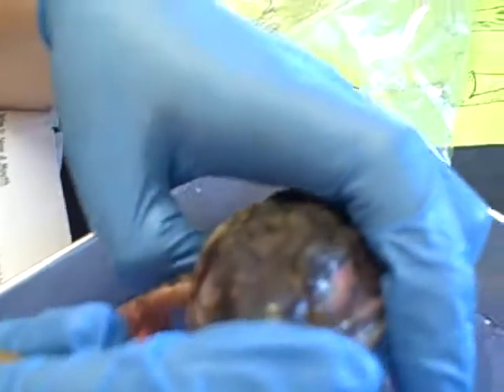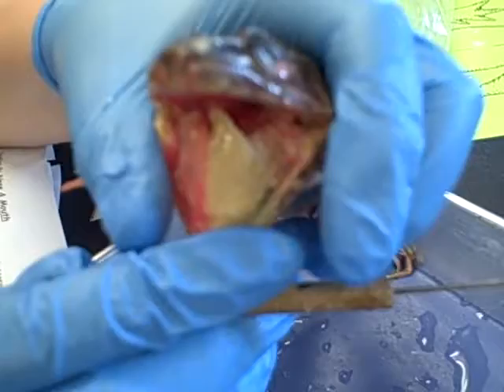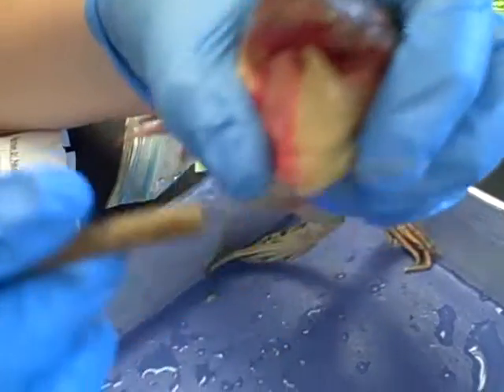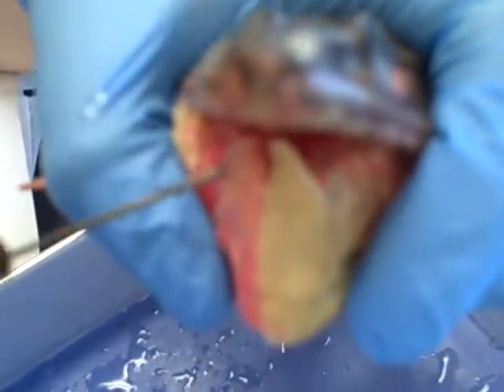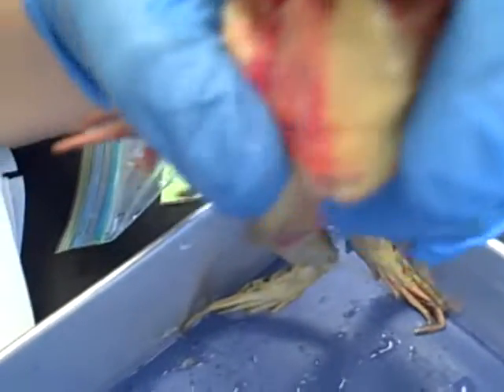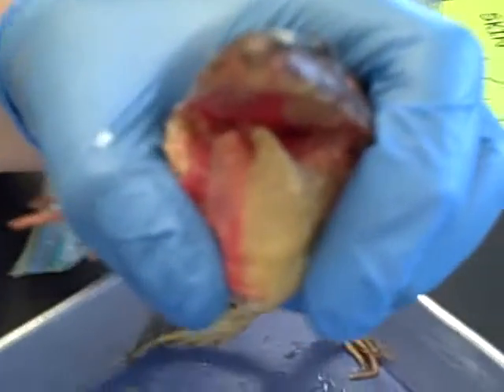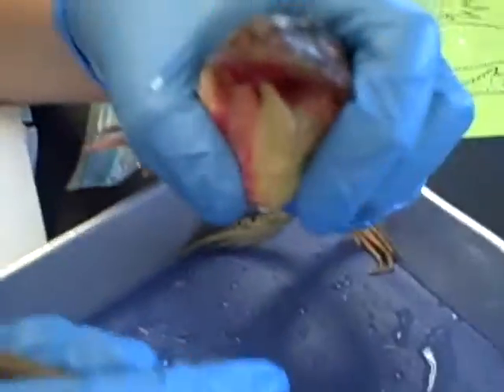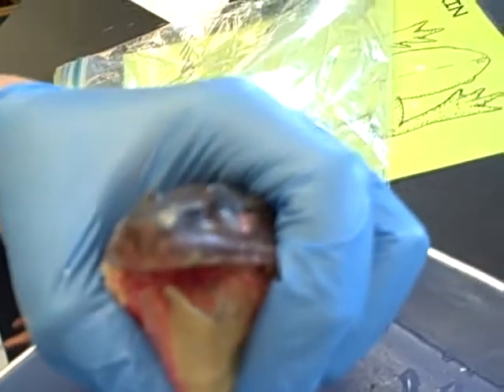Gently pry the mouth open and use scissors to cut the end of the jaw. The tongue is attached to the front of the bottom jaw. This is different from humans, where the tongue is attached to the back of the mouth. This allows the frog to quickly catch prey and push it into their throat.